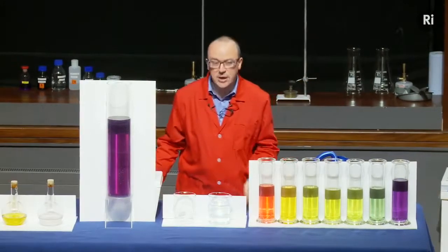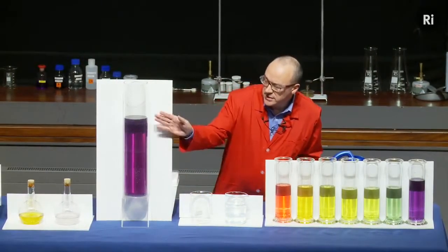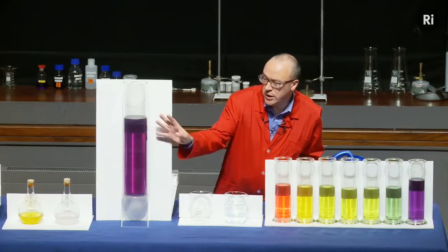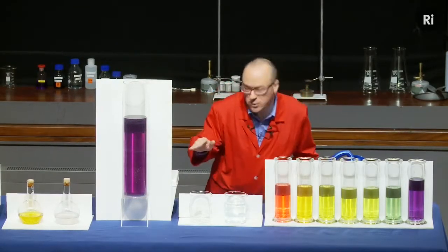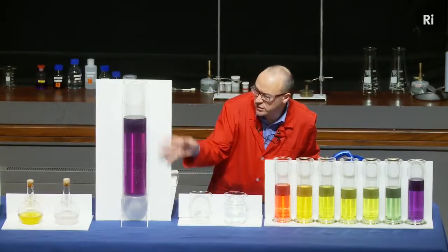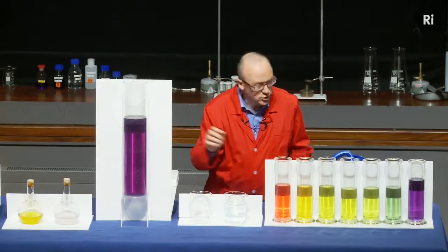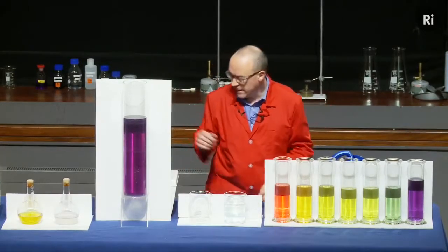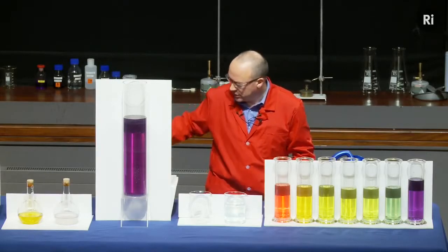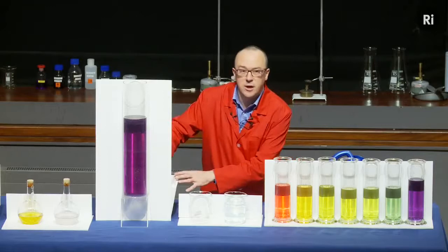But let me just show you now another example of a reaction involving universal indicator, and it's this column of water which has universal indicator and also a little bit of sodium hydroxide, which is alkaline, and so it's turned it this sort of bluey purple colour. I'm going to add some acid, and we should see it go through a sequence of colours rather like these. Now the particular acid that I'm going to use is acid that's going to be made in the water from carbon dioxide.